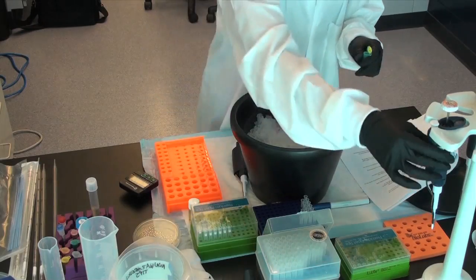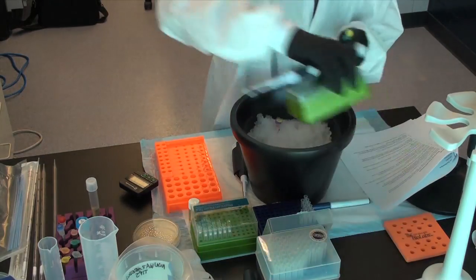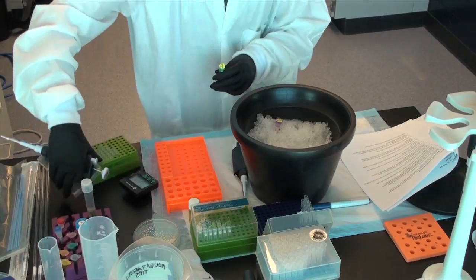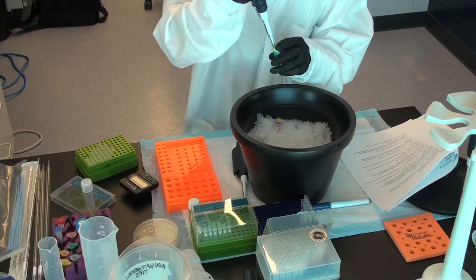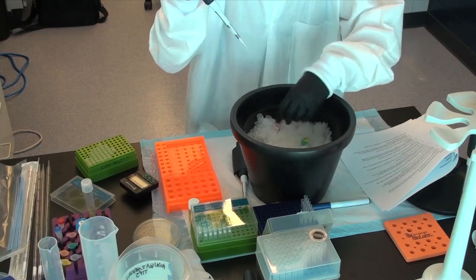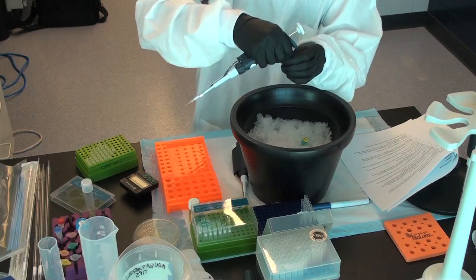Step 6: Pipette 2 microliters of the ligation reaction or plasmid product directly into the competent cells and mix by tapping gently. The remaining ligation mixture can be stored at negative 20 degrees Celsius.